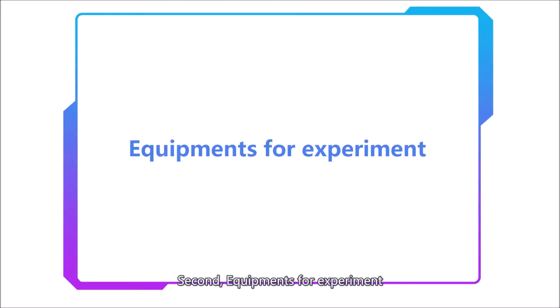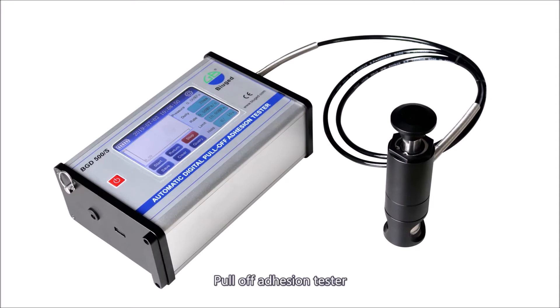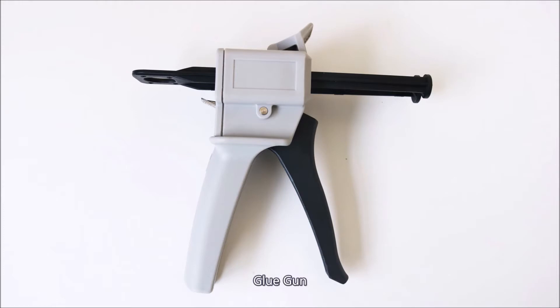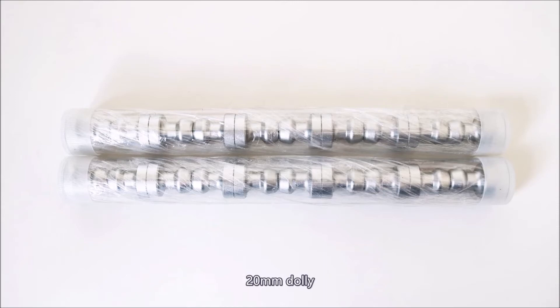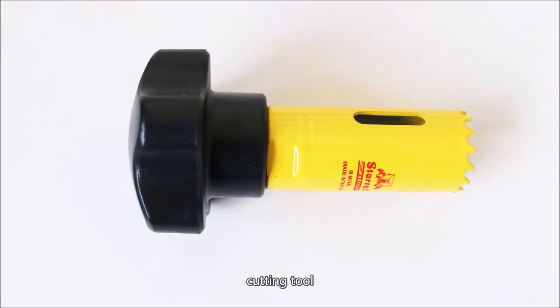Second, equipment for experiment. Pull-off adhesion tester. Glue gun. 3M glue. 20mm dolly. Cutting tool. Sample board.